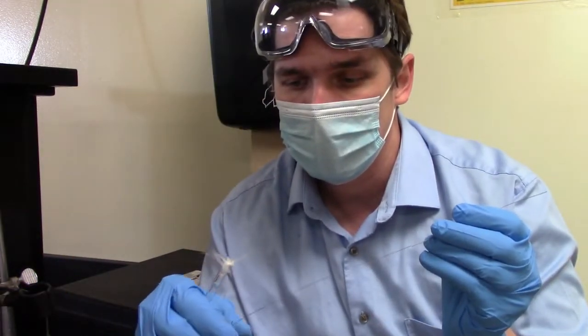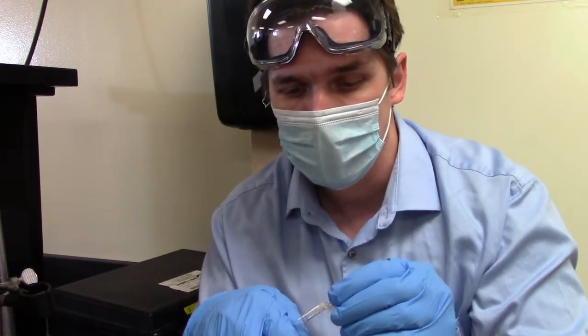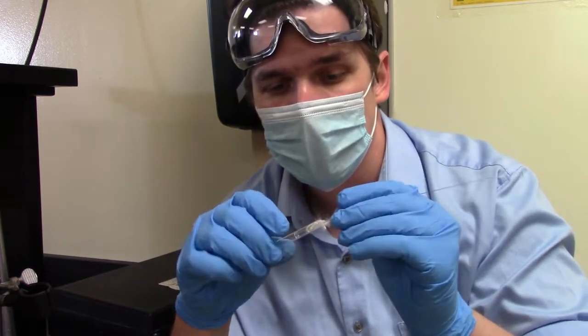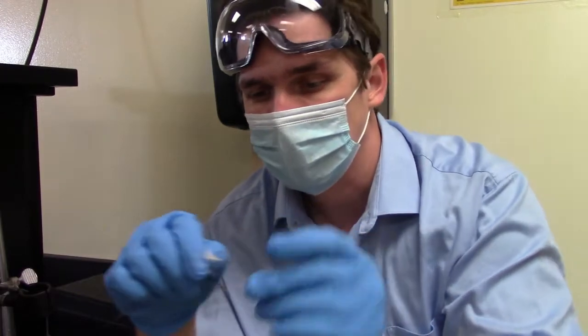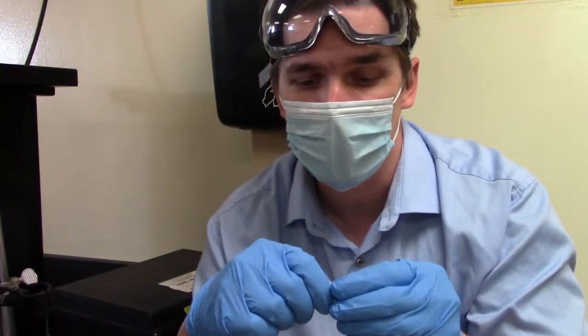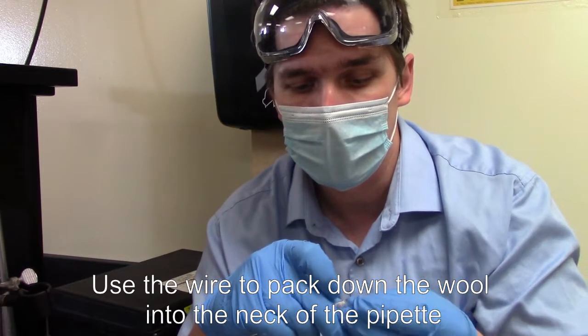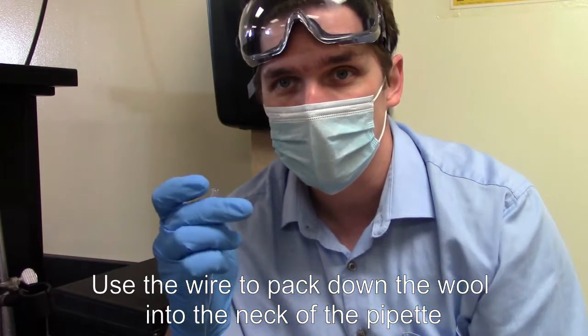So take it, cram it all the way down there. And you can already see this is trying to give me problems. And this is honestly the hardest part, is getting this glass wool into the bottom of the pipette. After this, it's actually really straightforward.